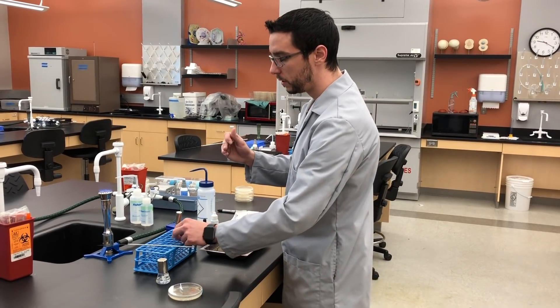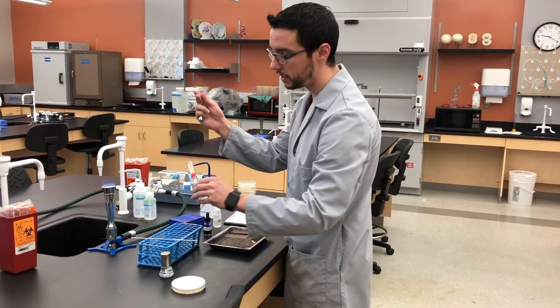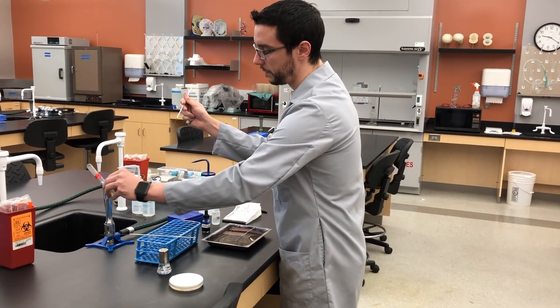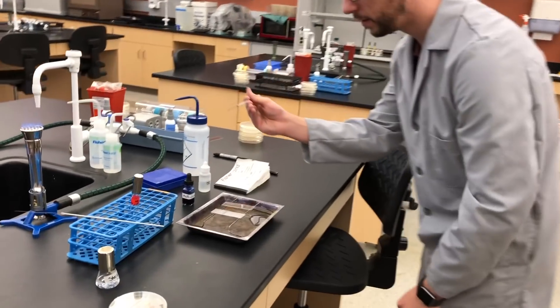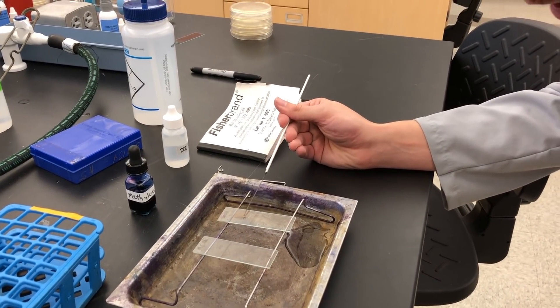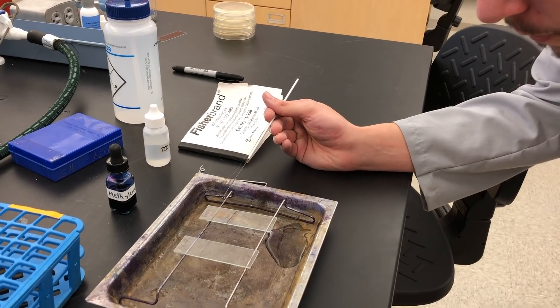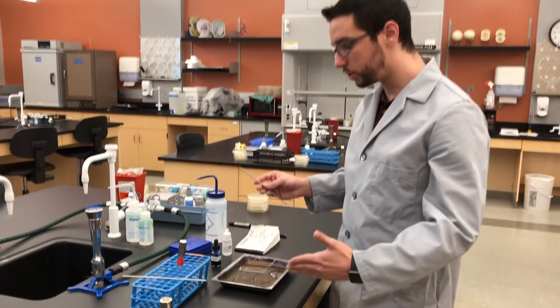This should be cool now. I'm going to simply, using sterile technique, collect some culture and with that liquid from the broth, simply spread it out across the slide. You may or may not be able to see it, but we already have most of our agar plate sample dry. At this point we are going to take a break and wait for these to air dry, and we'll come back.